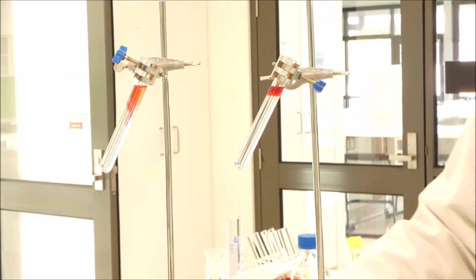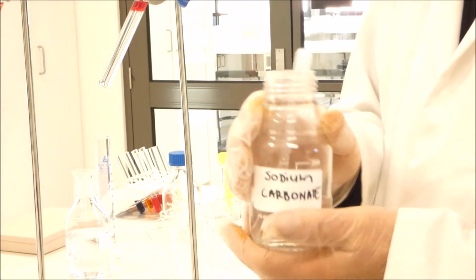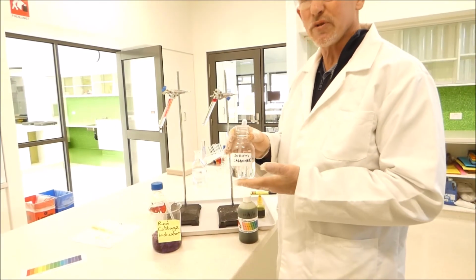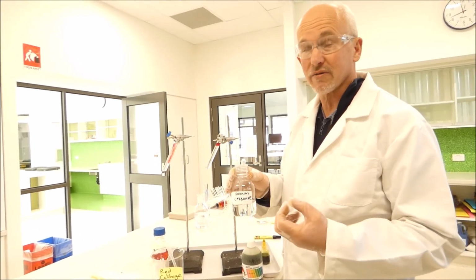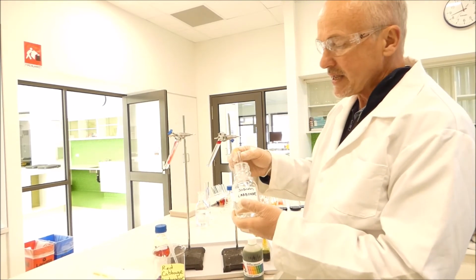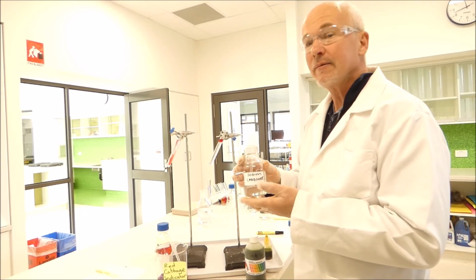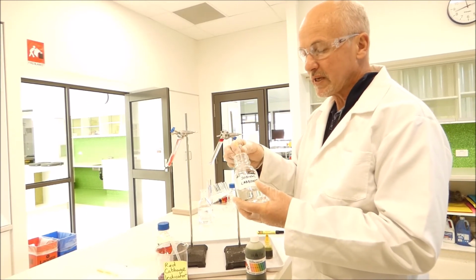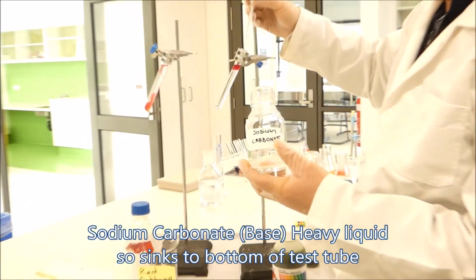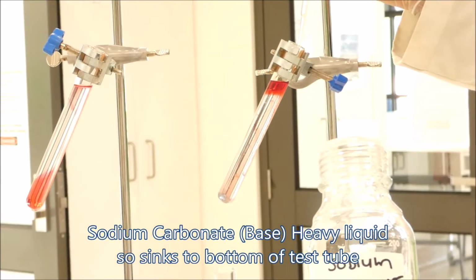What we're going to do now is we've got sodium carbonate solution. Now sodium carbonate is very basic, whereas the hydrochloric acid is very acidic. So you'd expect the two of them to react to start forming bubbles of gas and also to produce water and neutralise the solution. Sodium carbonate, because it's quite concentrated, is also very, very heavy. So if we put it down the side of the test tube, it will go to the very bottom of the test tube without mixing too much with the top solution of acid. So we'll put it down the side of the test tube very slowly.